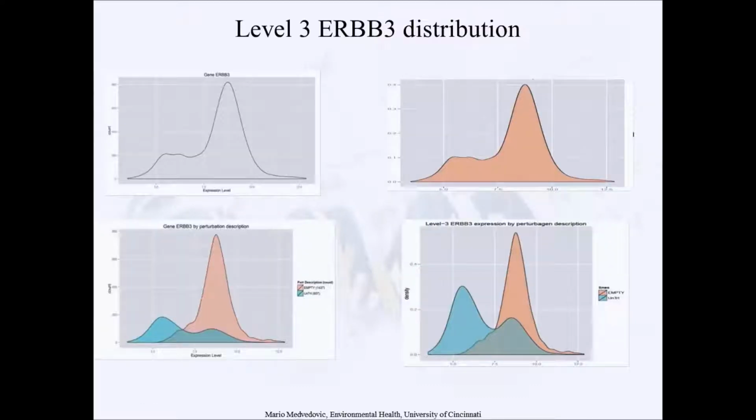So the first thing we did was to recreate Chad's results. What Chad did, he looked at the distribution of ERBB3 gene in the A375 cell line, and he looked at empty and untreated profiles, assuming that the distribution should be fairly simple across all these profiles for this one gene. And he looked at level 3 data. Turned out that there was this artifact, that there was a significant portion of genes that had very different gene expression level.